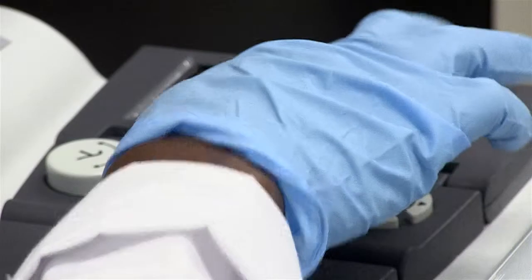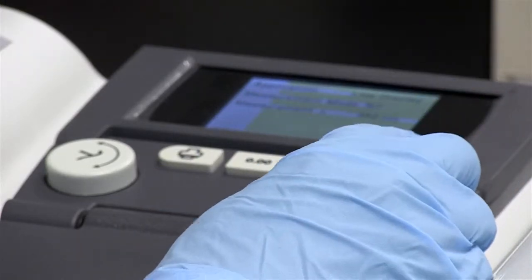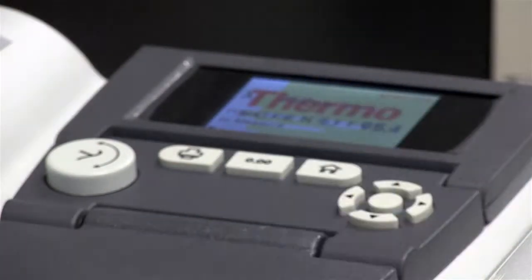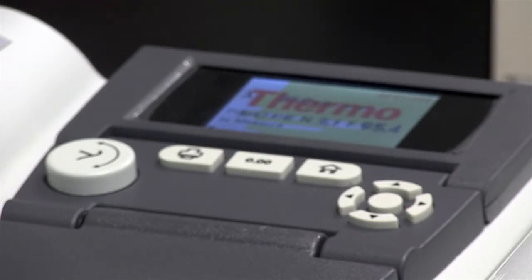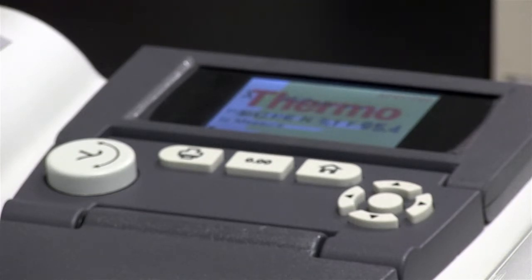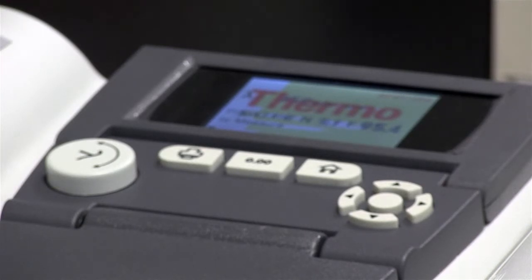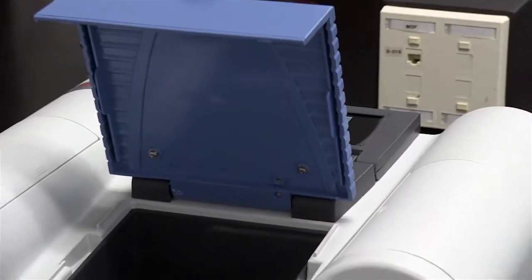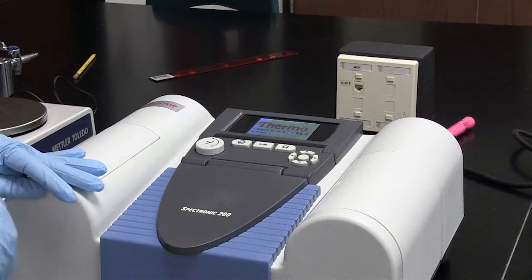To get the percentage transmittance, go back to the home screen, select the transmittance option, press go, and it will display your transmittance — here it's recording 95.4%. Before measuring each subsequent sample, you must blank again. Return the water blank to the holder and perform the auto zero procedure at the new wavelength. Blanking is the same as performing the auto zero option.